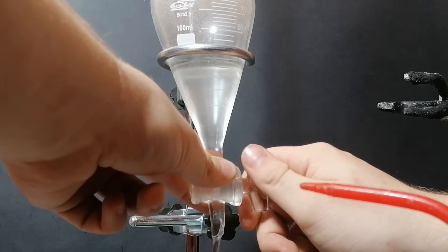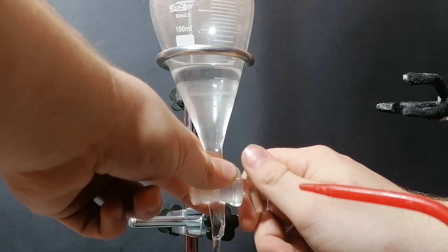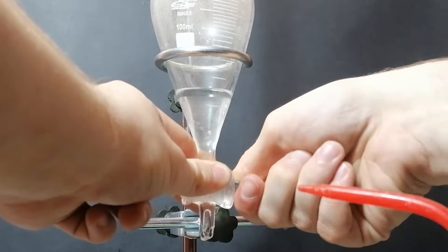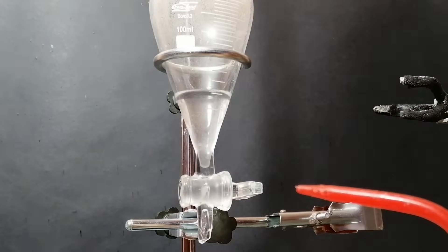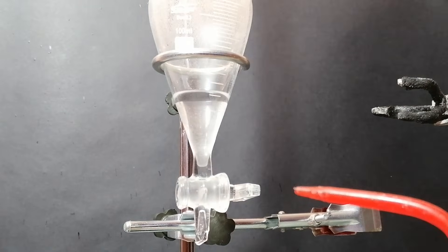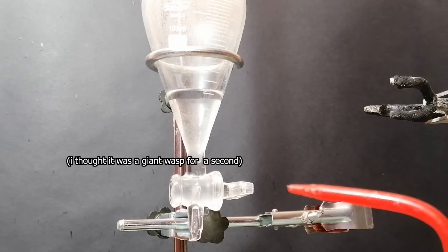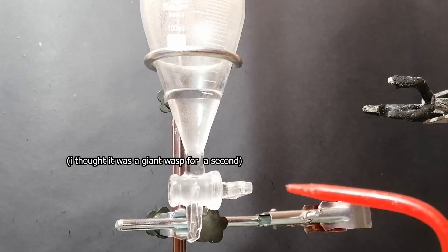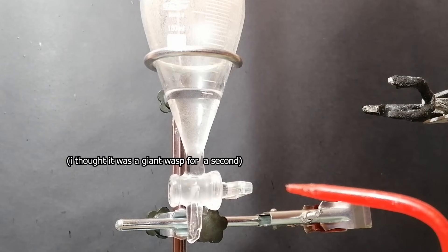Also, while I was decanting the diethyl ether layer, a giant bug threw itself through the open window of my lab and catapulted itself onto my table. I did get scared, but I guess the joke's on him, because there was enough diethyl ether in the air to put down a small pitbull.